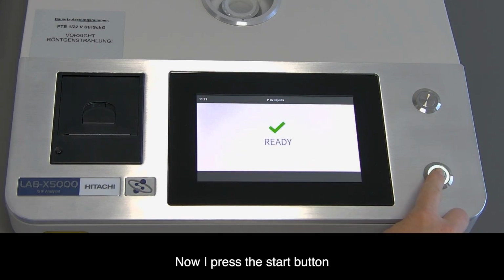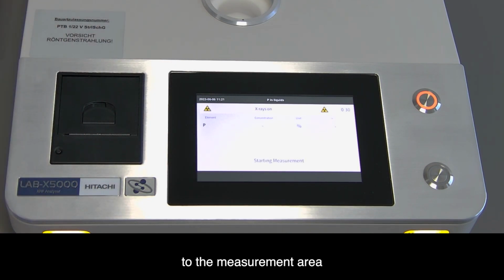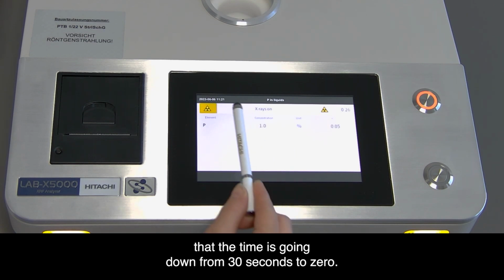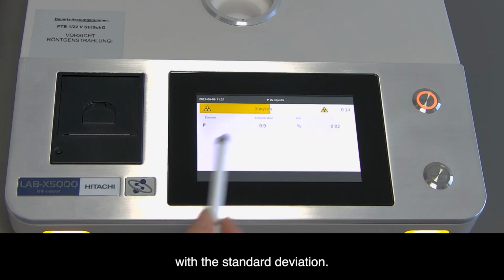Now I press the Start button, and the sample is turning to the measurement area. In the software, you can see when the measurement conditions have been set, that the time is going down from 30 seconds to 0. You can see directly a live result with the standard deviation.